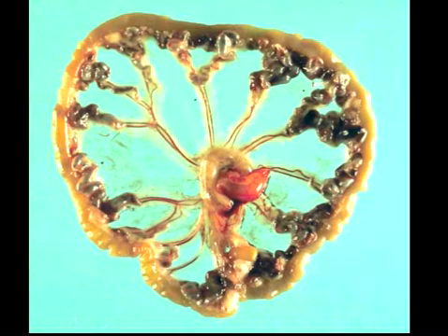Proliferative is the fact that you have a combination of smooth muscle hyperplasia, which is in great disarray, and then in the outer media and the adventitia, you have tremendous numbers of fibroblasts which are secreting collagen. So it's both necrotizing and proliferative, and that's my morphologic diagnosis.